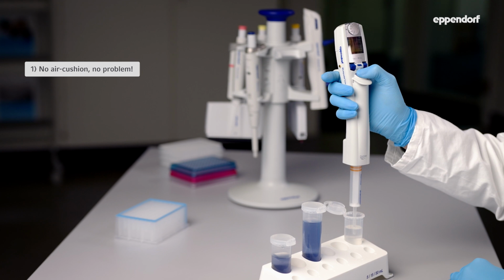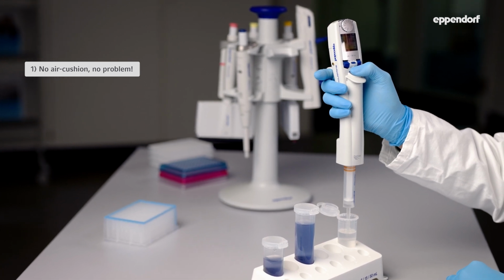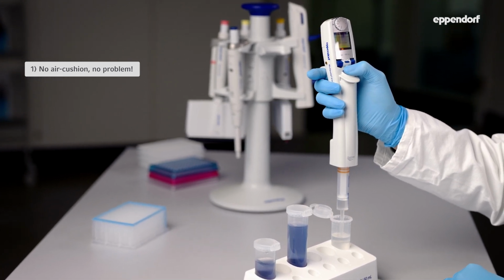So let's summarize. Here are the key points. The best choice for pipetting any liquid is the positive displacement system. The reason these tools aren't the only type used in labs around the world is the price. Tips with an integrated piston are much more complex and thus more expensive than standard pipette tips. When you're using an air cushion pipette, an electronic one is best because it's easy to adjust and it comes with a reverse pipetting mode and adjustable speed settings.